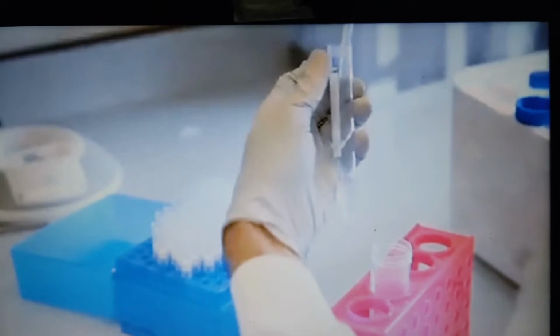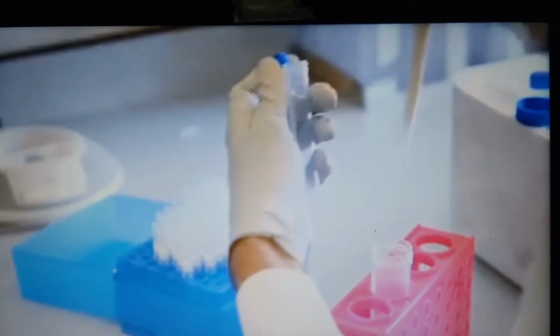Gently resuspend the rabbit IgG agarose solution by swirling the bottle, before removing the agarose to a 15 ml tube. Wash the agarose 3 times in chilled lysis buffer using low-speed centrifugation to clarify the beads at each step. The pelleted rabbit IgG beads should be visible after centrifugation. After each step, carefully remove the buffer without disturbing the beads.